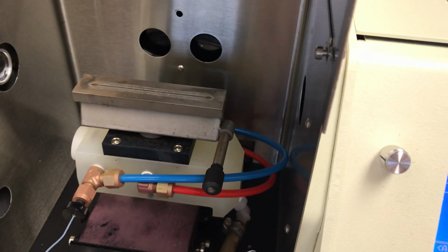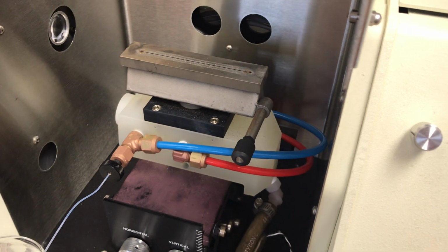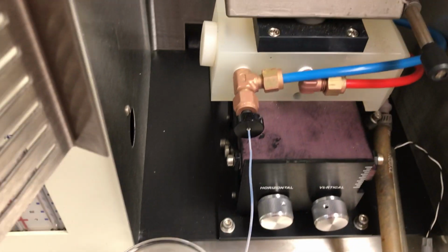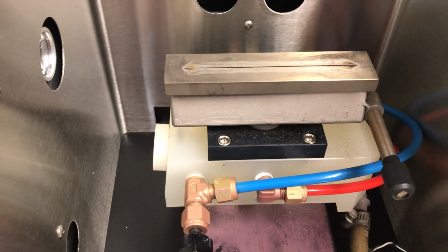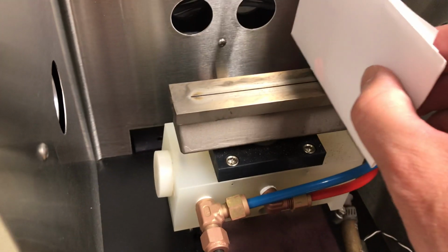Alright, so at this point, we want to lower the burner position to well below the optical path of the lamp. So I'm going to bring this way down by turning the knob to the left. Now the problem here that we have is that some of these have been stripped, so I need to actually physically move the burner head down once I turn the knob. At this point we should be actually well below the beam path. And I can double check that with, for example, a piece of paper or a card. You probably can't see that very well, but you might see an orange circle there that indicates the output of the hollow cathode lamp. And you can see that I can see the full circle there.